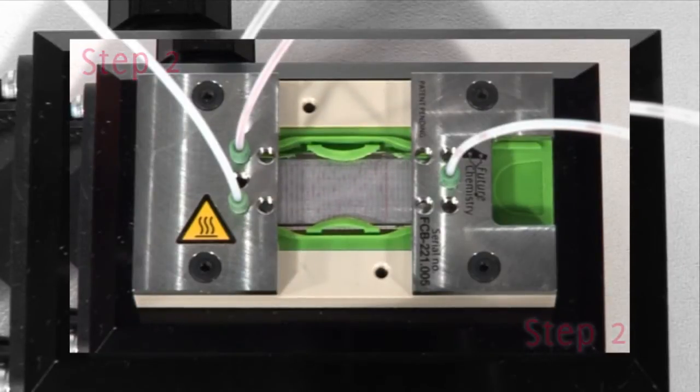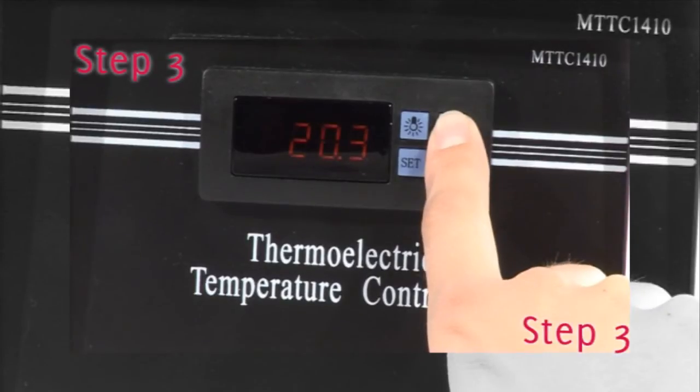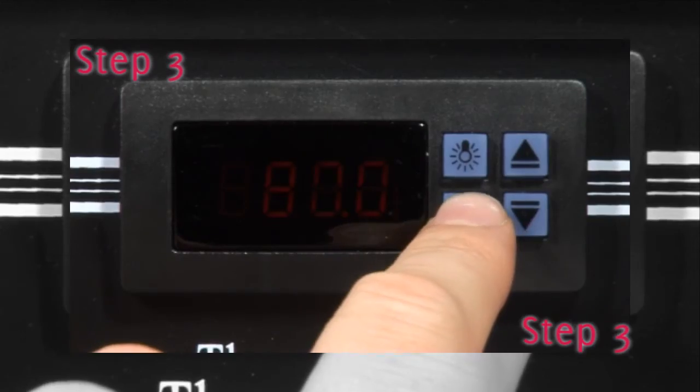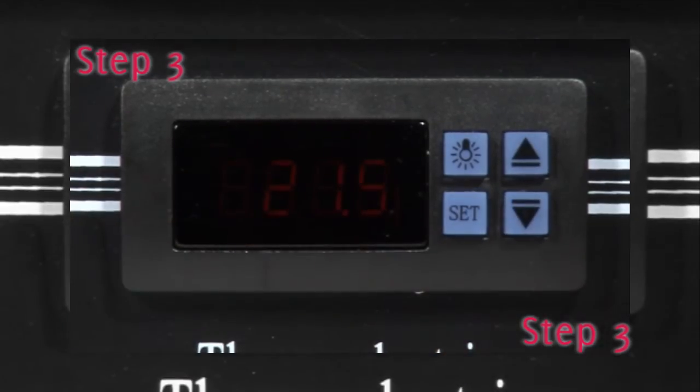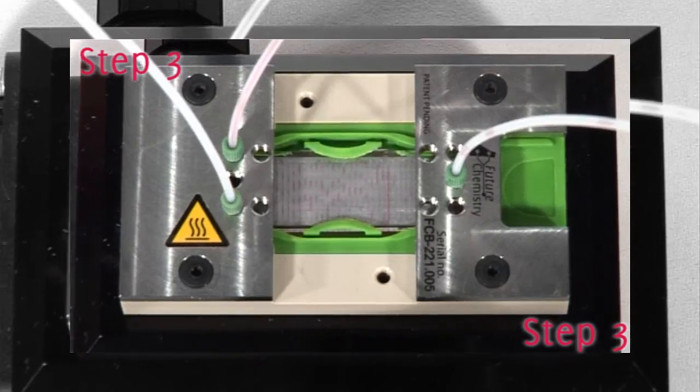In the third and final step, the temperature is set to the desired level. After confirmation, the temperature inside the micro reactor quickly reaches this level. Now that the system has been started, the reaction takes place automatically inside the micro reactor.